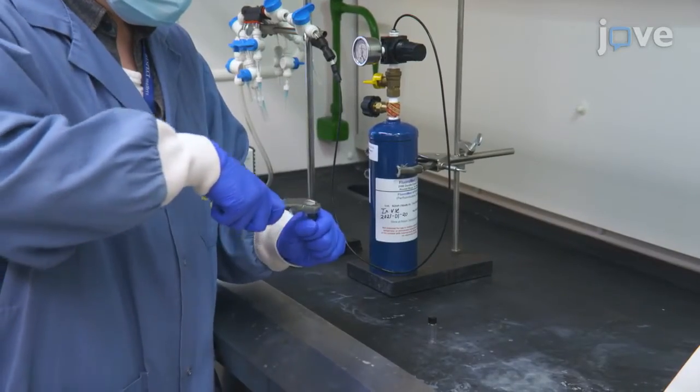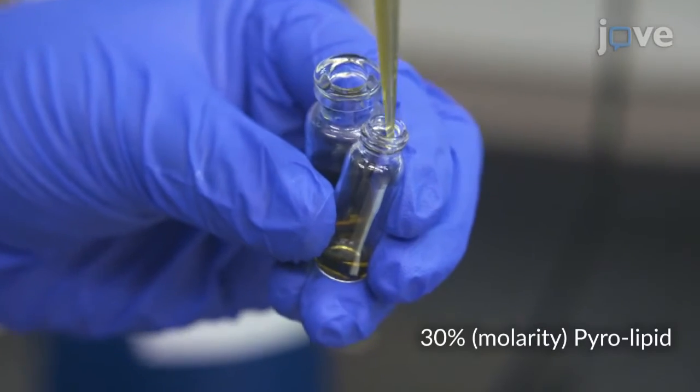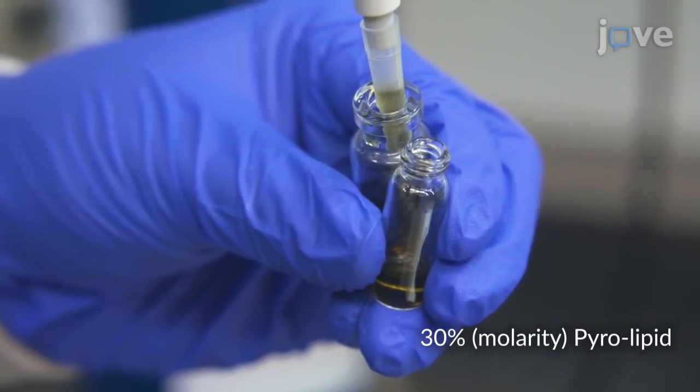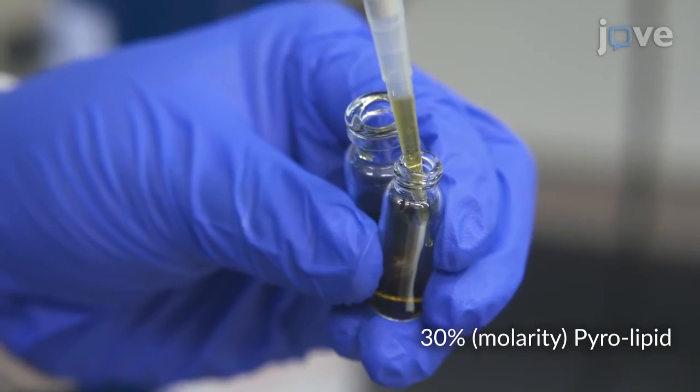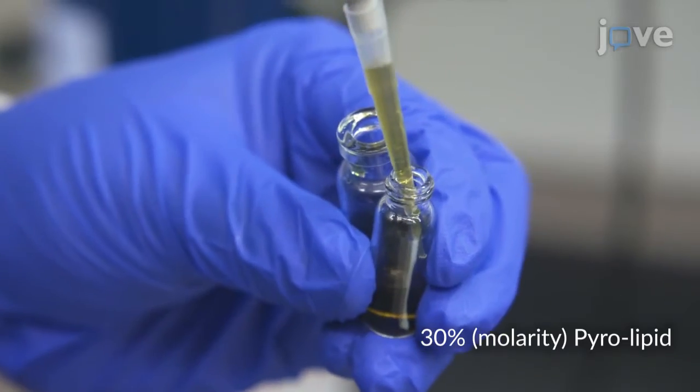Using a decapper, remove the aluminum seal on the serum vial and transfer 1 ml of the lipid solution to a 1.85 ml borosilicate glass sample vial with a phenolic screw cap by letting the lipid solution flow down the interior wall without creating bubbles.